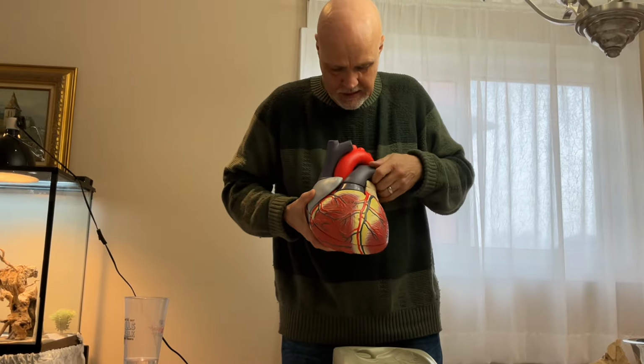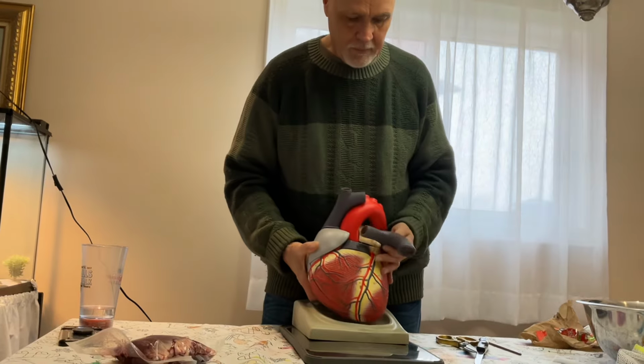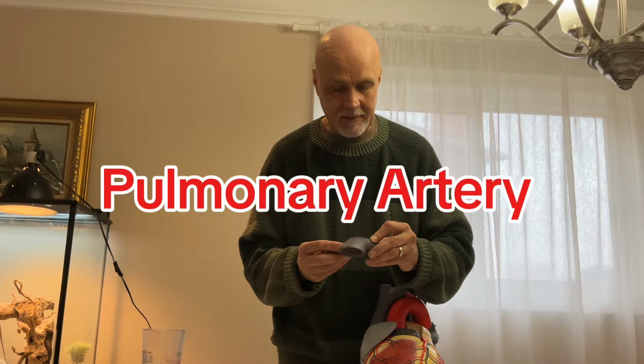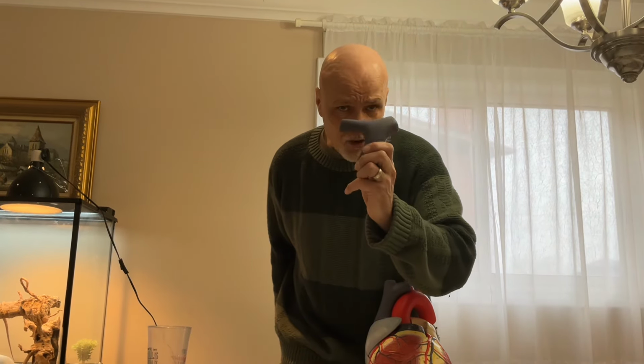Now, this one here, boom, is called the pulmonary vein. Now, veins carry blood away from, pulmonary artery, my bad. They carry blood away from the heart, away. Now, the reason why I called it the pulmonary vein, and I was slightly confused, is this is the only artery in the body that actually has deoxygenated blood, which we represent as blue.